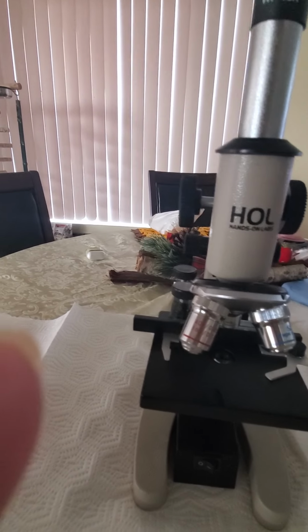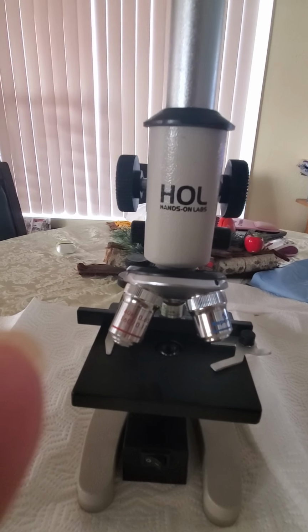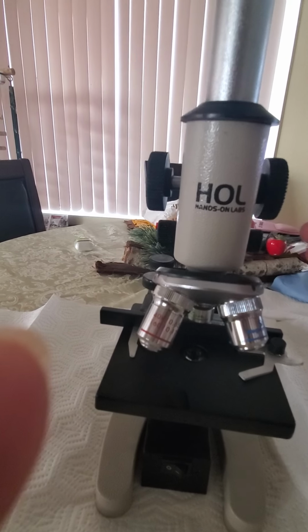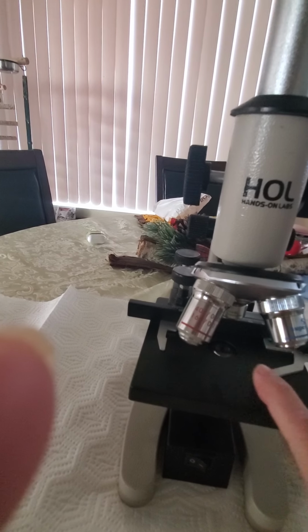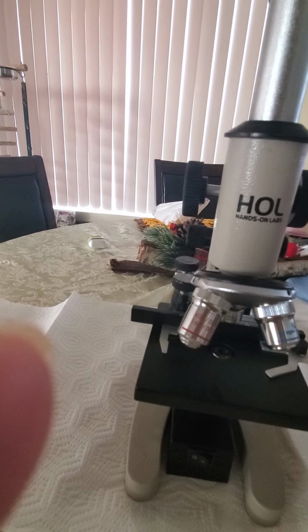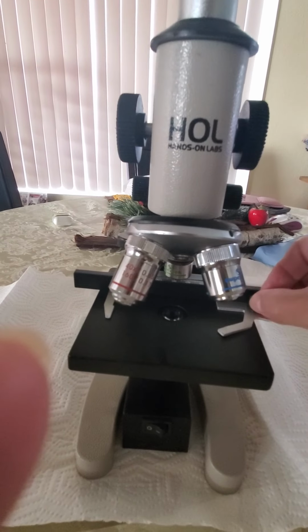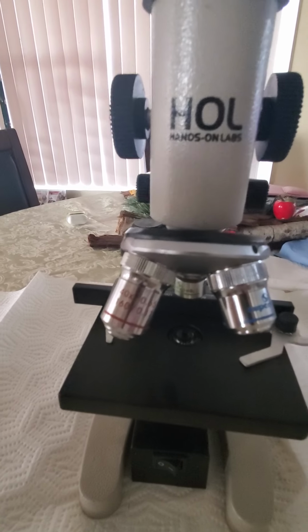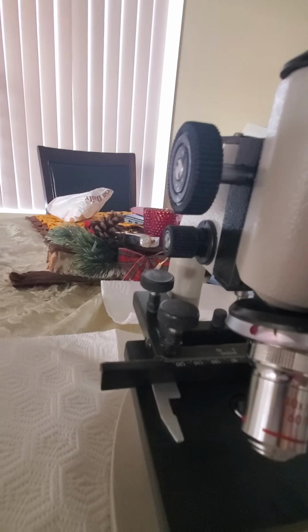Now we have the oil immersion that we work with, and that will give you 100 times the magnification to view an object. We'll talk more about it as we do our experiments. So let's move to the stage. This is your stage. These are the clips that hold your specimen. The clips are very important so they can hold your specimen when you are looking at the object. Now, how will you move your object in the event that it is too close, too far, too back, or too forward? So I'm going to move to the side.